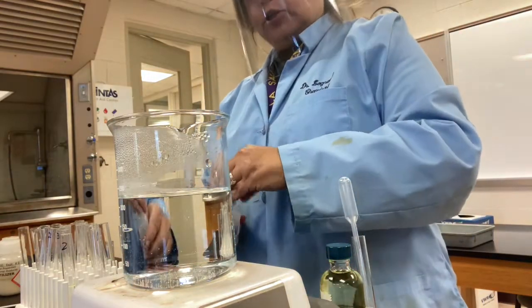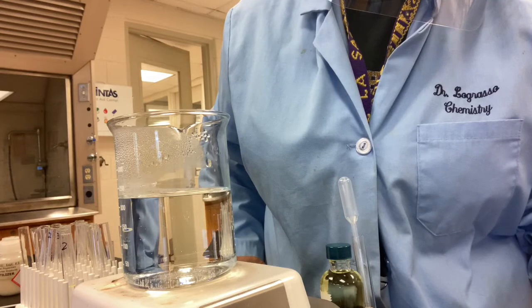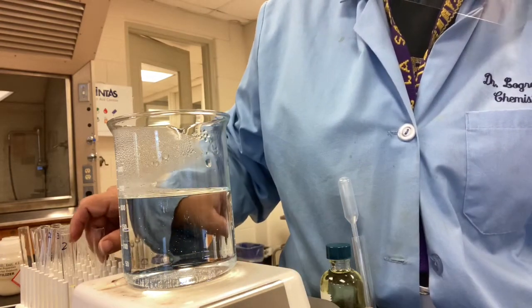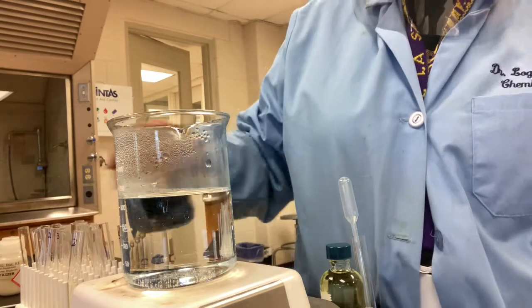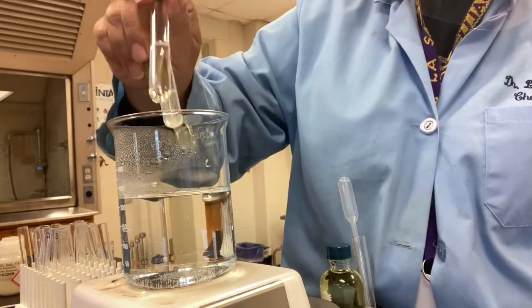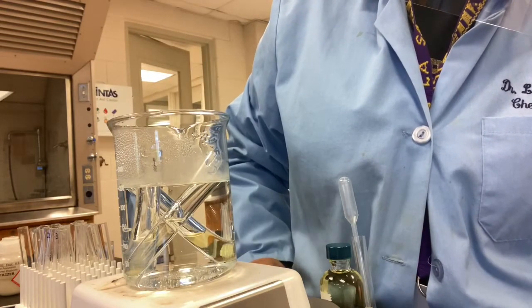All right, so then I'm going to, according to my instructions, add the test reagent, but it also needs to be heated in order to activate the reaction. So before I add the molybdate, I'm going to put them in a boiling water bath. So this is not boiling. So let's get it boiling, and we'll put it in here, and we'll wait for it to boil, and then it has to boil for a few minutes. So let's let it boil.